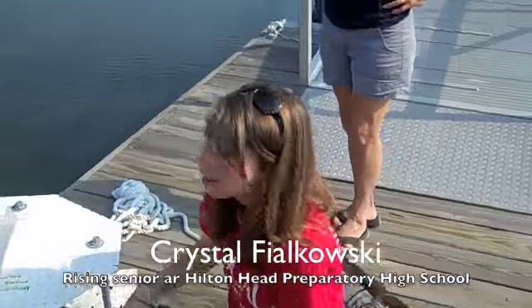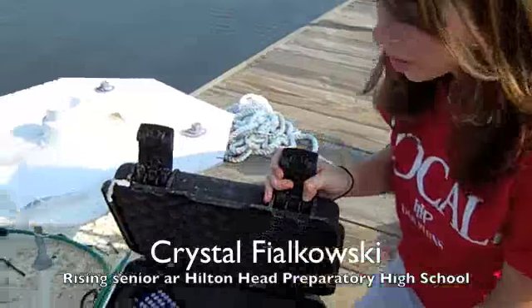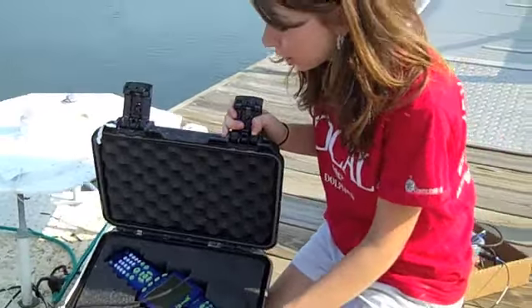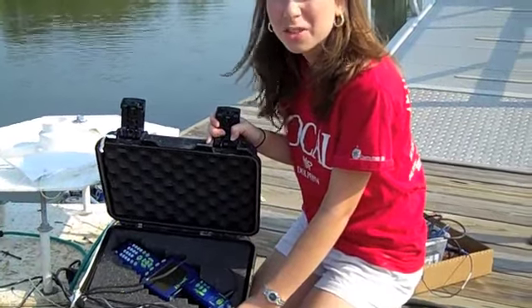Is this our sensor, and should I open it up? Yeah, that'd be great. And this is what we use to test the water. Basically, we're testing conductivity, dissolved oxygen, and salinity, and it's really interesting to see how the water is affected around here. And it's interesting for the wildlife too.